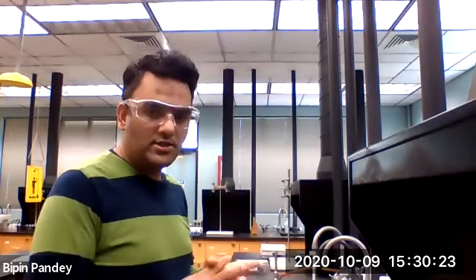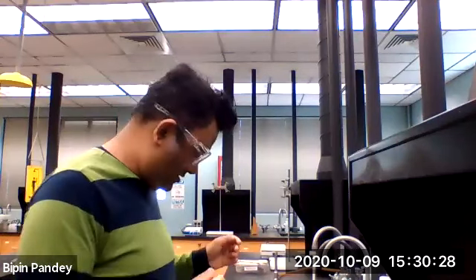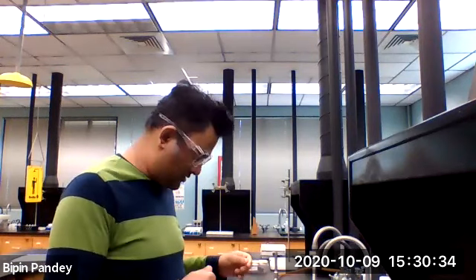Hello and welcome. So this is our Lab 8, chemical reactions. In this lab we are going to do a few chemical reactions. So let's look at reaction number 1.